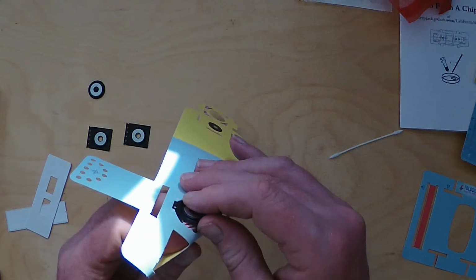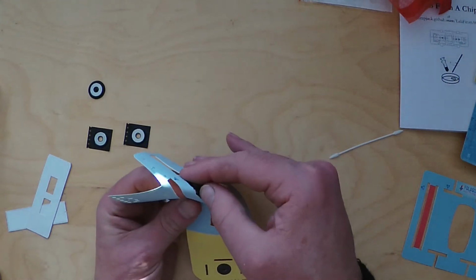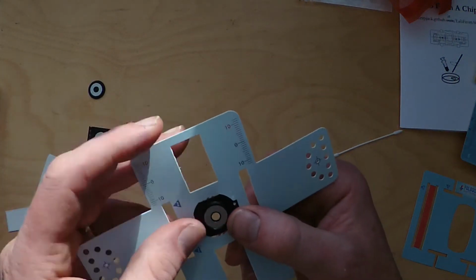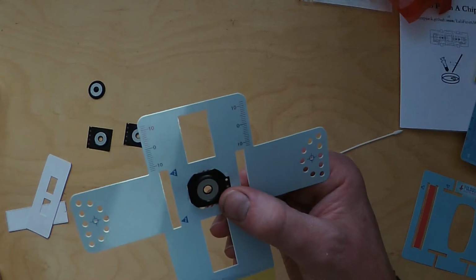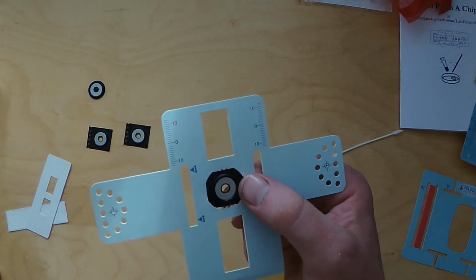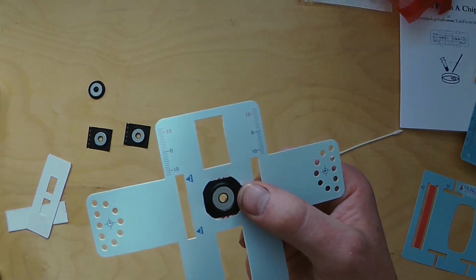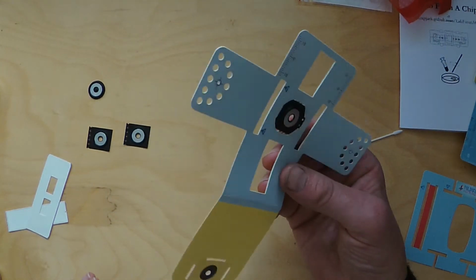You can bend the coupler and the card to fit. So I find you bend them both down, squeeze them in, so you end up with this, with each corner tucked inside. The red hazard lines are kind of covered up, and it's secured nicely there with this silver part up. And again, that's just to make sure the right combination of couplers magnetically snap together and hold the slide in place. Okay, so that's one step done.